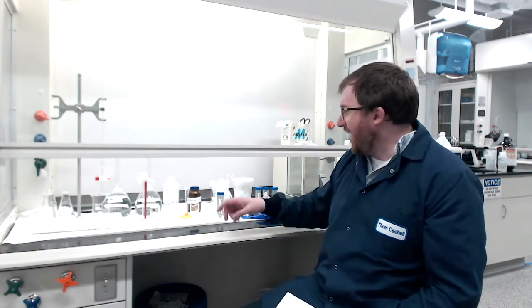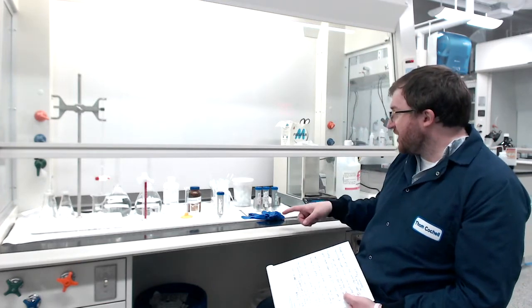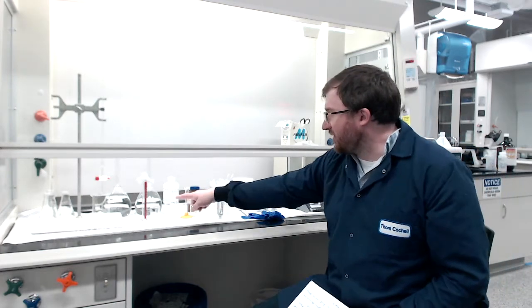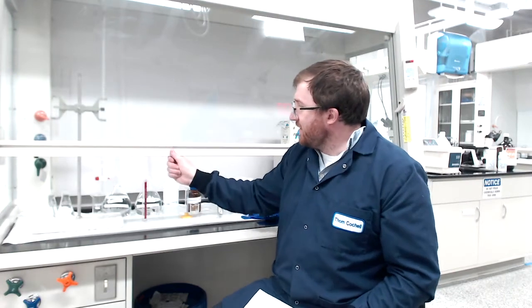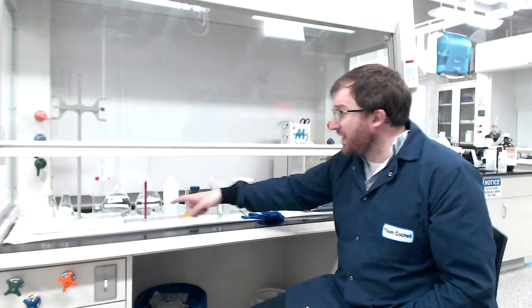In addition, we have a starch solution — it's cornstarch in solution, a 0.5 weight percent starch indicator solution. Other equipment includes plastic transfer pipettes, a glass stir rod, multiple beakers for measuring and waste containers. We also need a burette with a stopcock so we can control the flow of the sodium thiosulfate. And then we're going to have an Erlenmeyer flask to put our solution in. Those are all the equipment and materials needed to perform this iodometric titration.